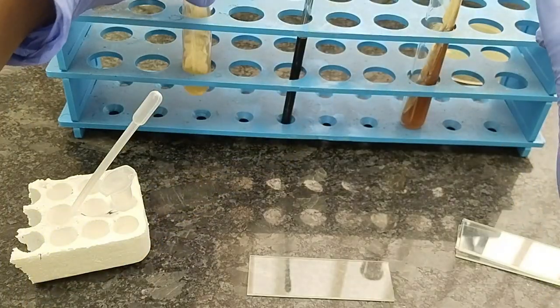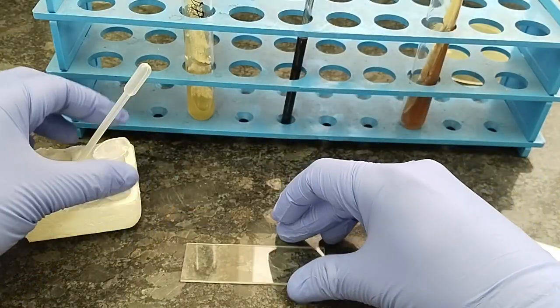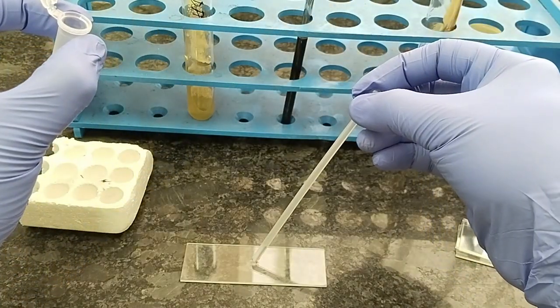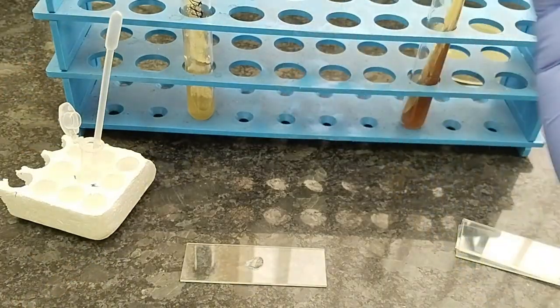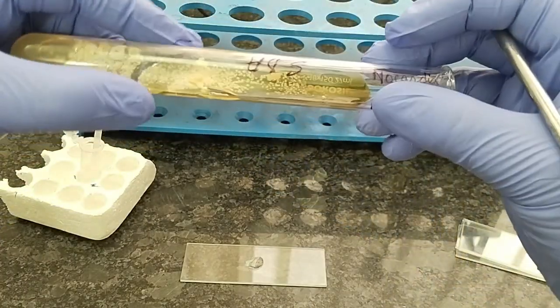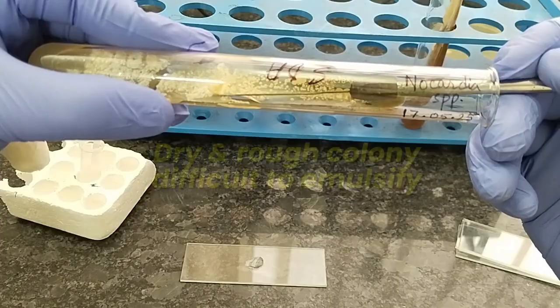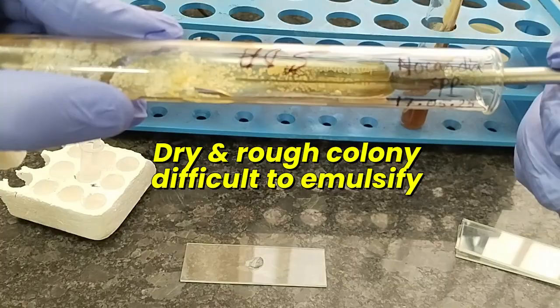So first of all, for the preparation of smear, we have to take a slide, then put 1 drop of normal saline here, just like preparation of any other colony smear. Just open the media, open the cotton cap, and try to obtain the colony. It is very difficult.